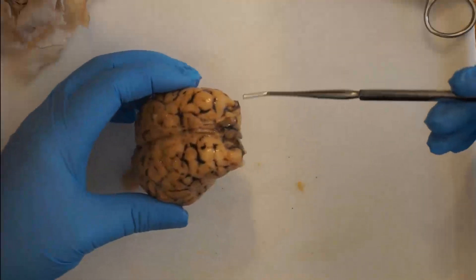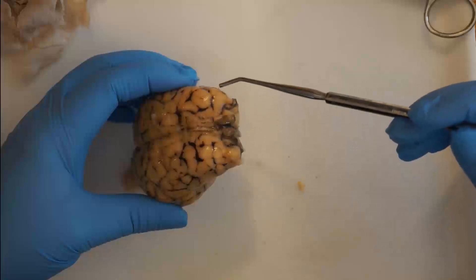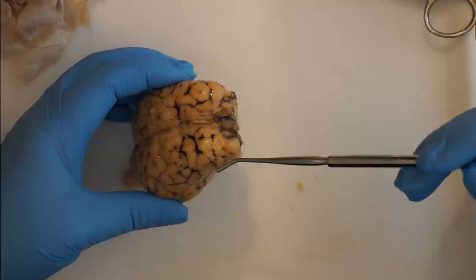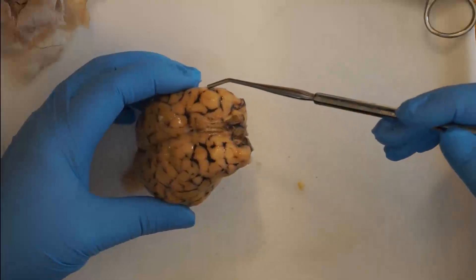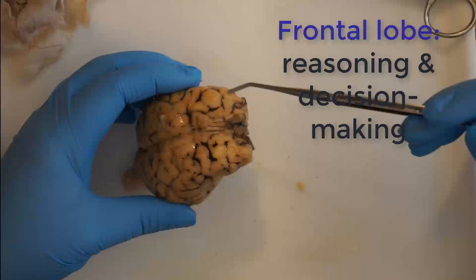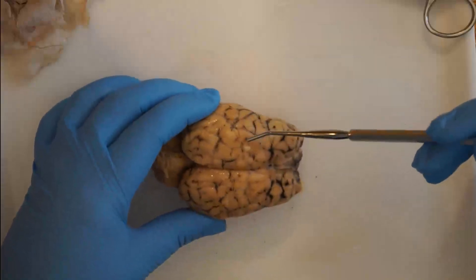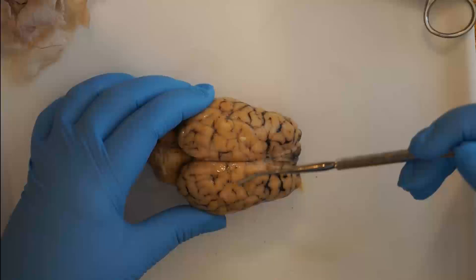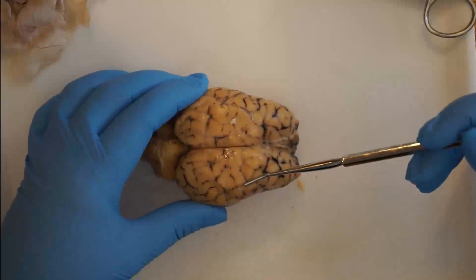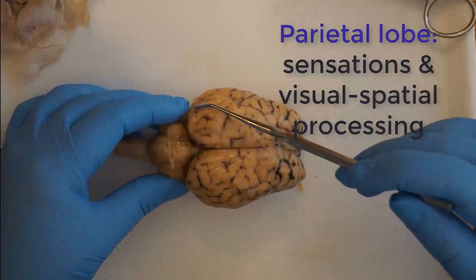Looking at the lobes of the cerebrum, in the front you have the frontal lobe, which is smaller in sheep than it is in humans. It's much bigger in humans, and the frontal lobe is responsible for reasoning and decision-making. Behind that are the parietal lobes, responsible for sensations and visual spatial processing.